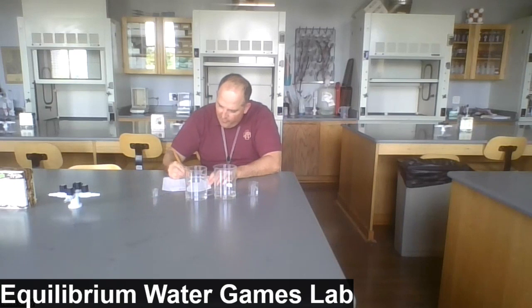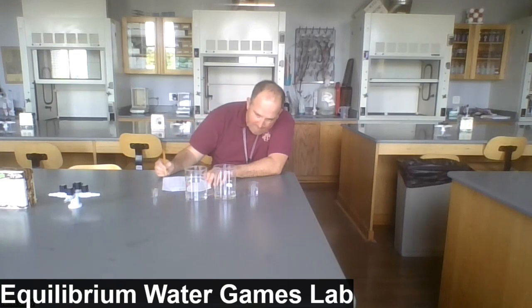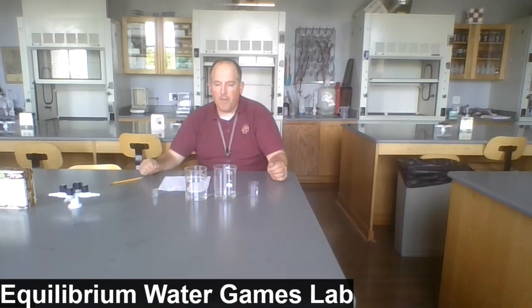I'd say we're at 95 milliliters in beaker A. This is after transfer cycle 12. And we're at 420 milliliters in beaker B.